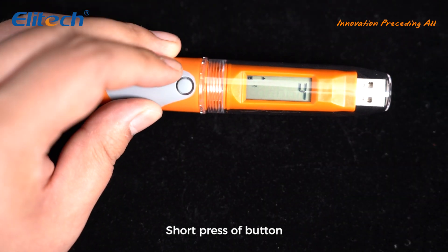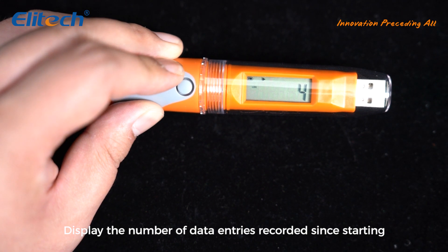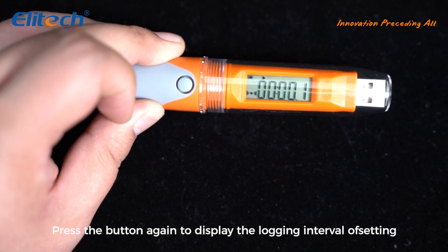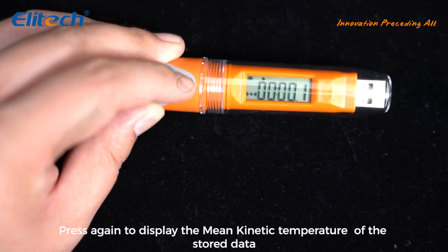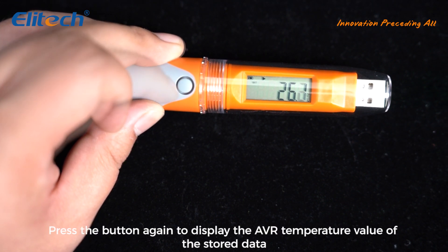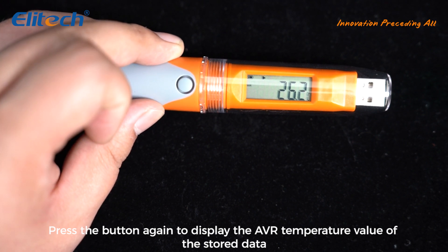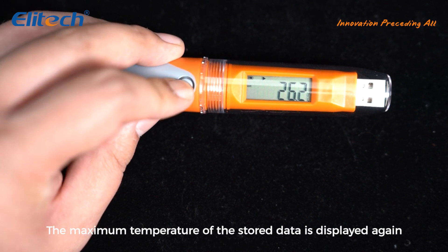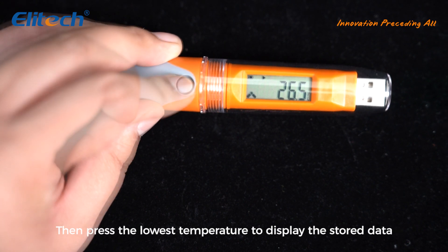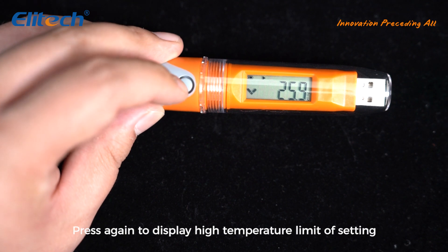Short press the button to display the number of data entries recorded since starting. Press the button again to display the logging interval. Press again to display the mean kinetic temperature of the stored data. Press the button again to display the average temperature value of the stored data.